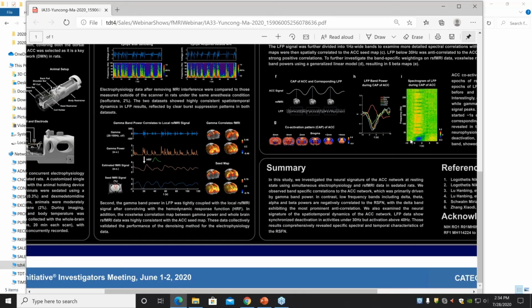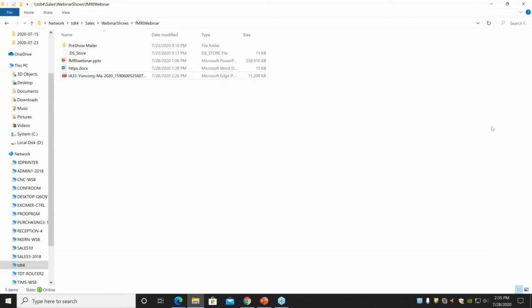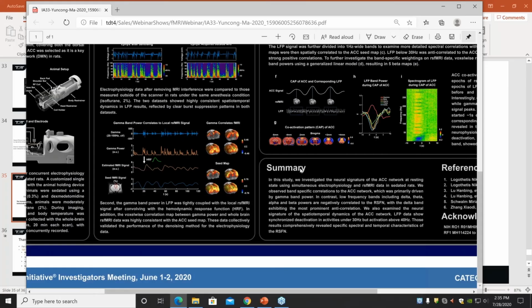Yeah, that's cool. So based on the literature, the gamma band power is tightly correlated to the fMRI signal. So we replicate the method, get the gamma band power from the ACC and convolve it with the hemodynamic response function and compute the correlation to the whole brain voxel-wise resting state fMRI signal. So on the right, we show the spatial consistent similarity between the two maps obtained from the gamma band correlation to resting state fMRI and seed map correlation. And this result is consistent with previous literature reports. So we are confident about this simultaneous recording platform.